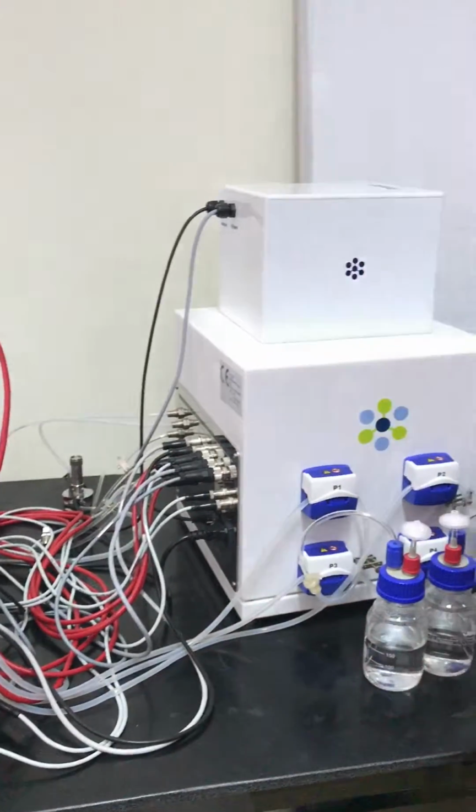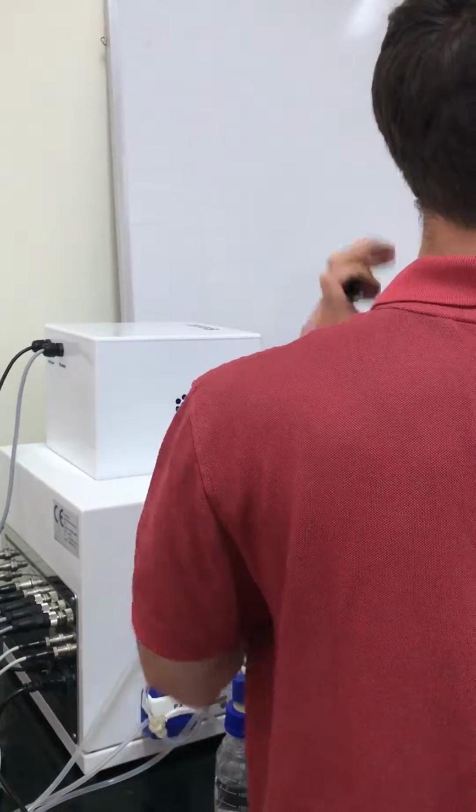Okay, so it's already ready to go, but I will explain to you very shortly the PID system.